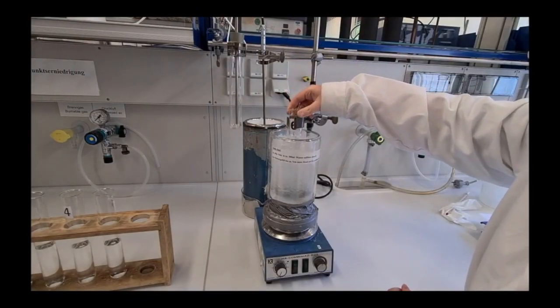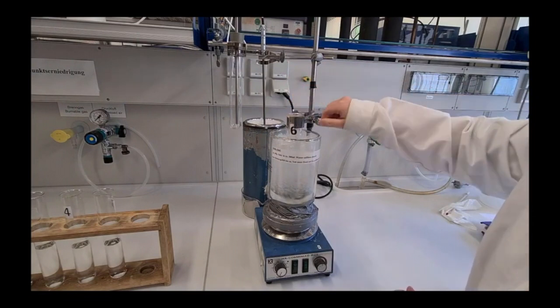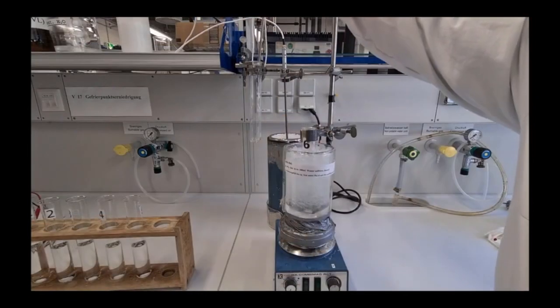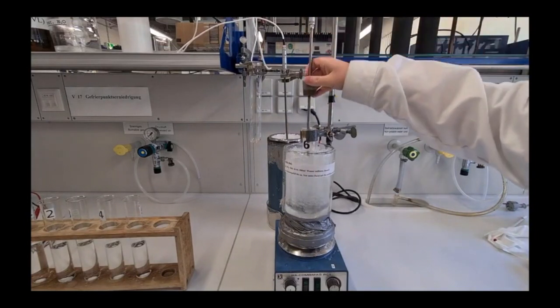The test tubes are hung one after the other in the cold bath. Check whether the stir bars move freely. The temperature probe is placed in the center of the test tube.